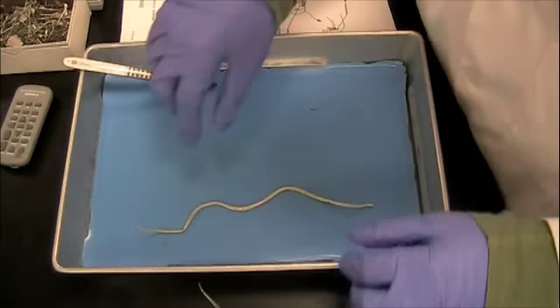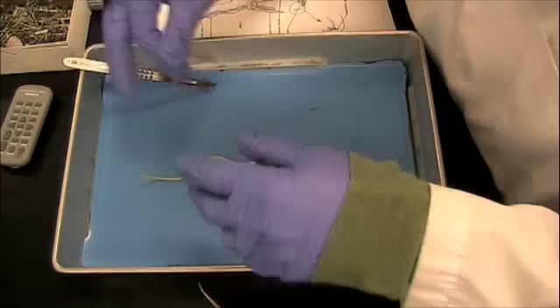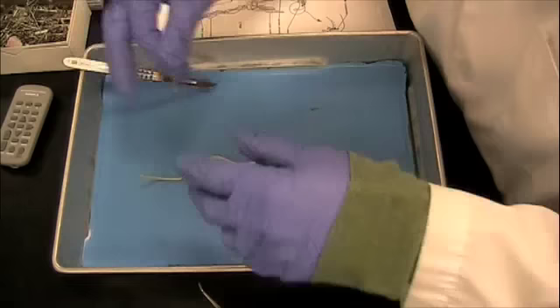I'm going to put them in the center of my tray and go ahead and pin it down to the dissection pan. This makes cutting a little bit easier to work with.